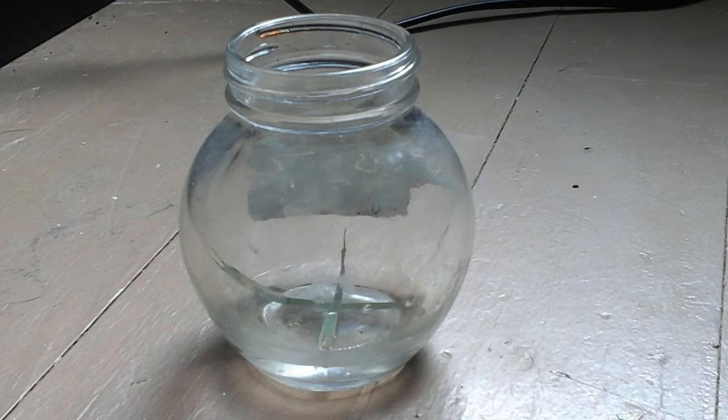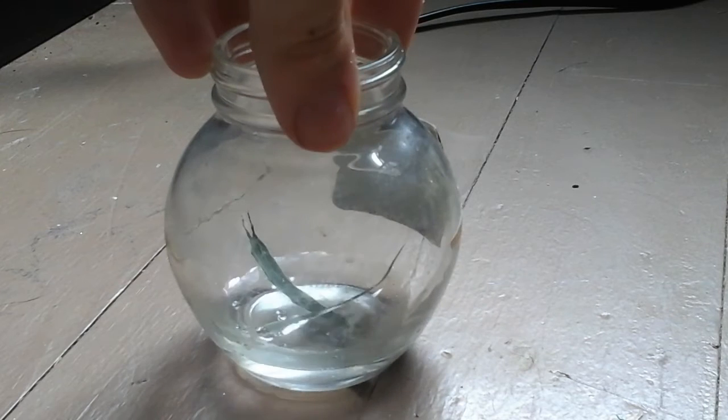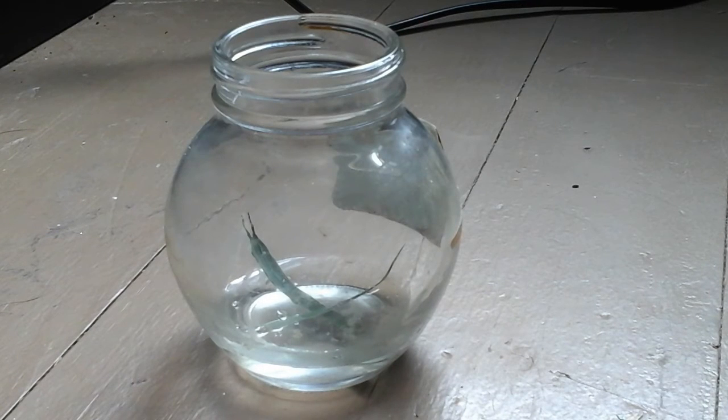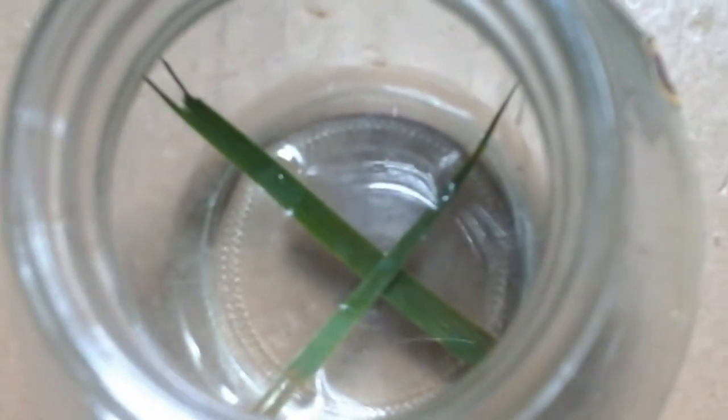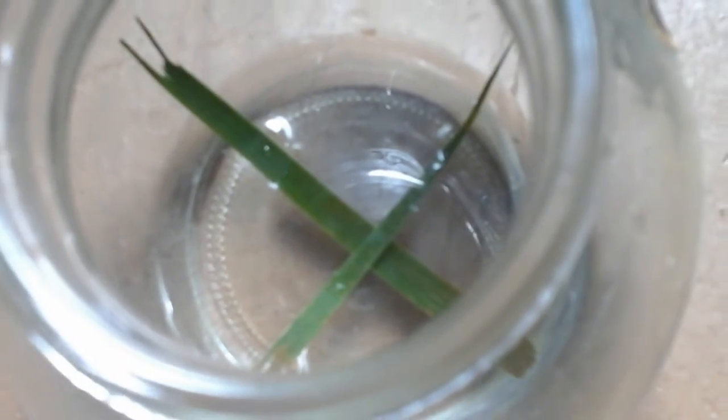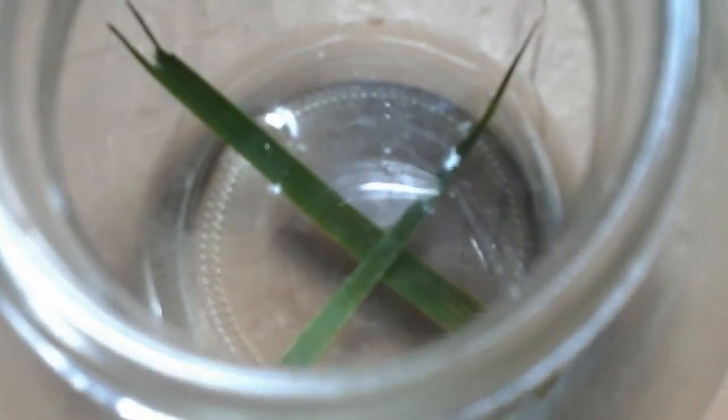I promise no plants are being harmed in the making of this experiment, but actually they are on the inside. Doesn't look like anything's really happening, maybe it's turning a little yellow. I'll pause the video and restart it once I notice something happening.